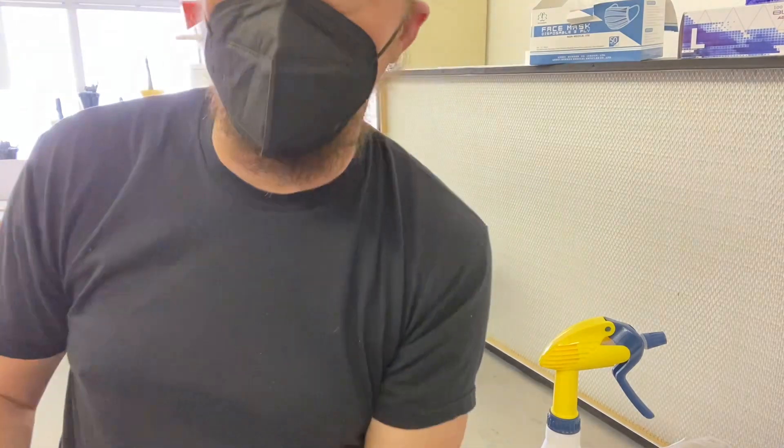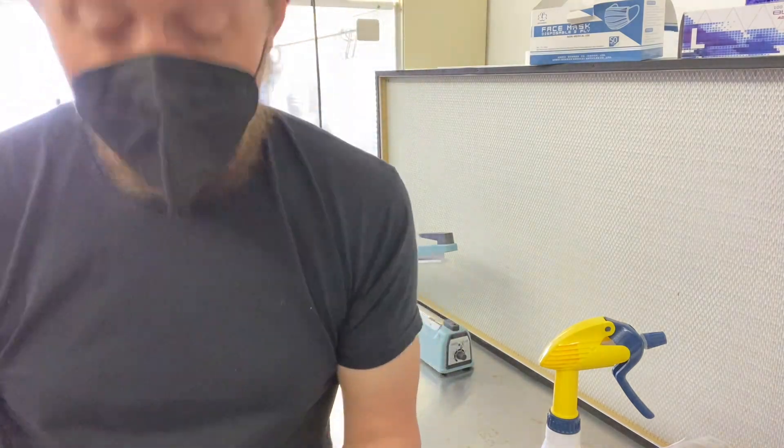And if you think your hands are clean and you don't have anything in your fingernails, grab a clean agar plate and a swab. Take the swab, roll it around the inside of your cuticle, then rub that swab on the agar plate. I guarantee you, in about a week, something's going to grow.